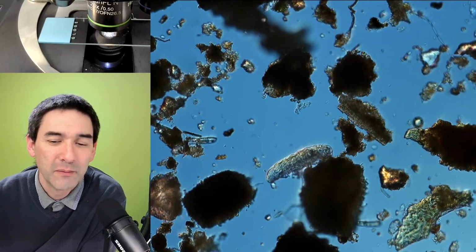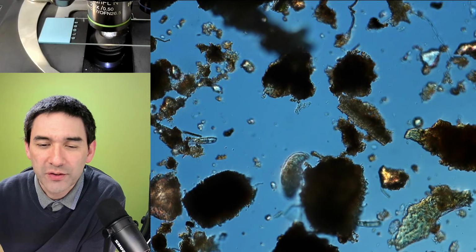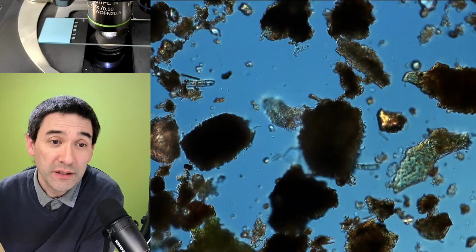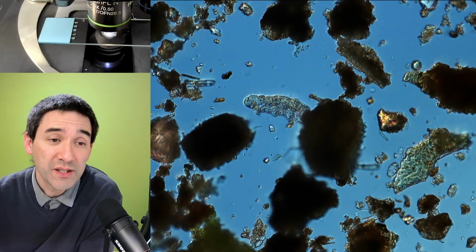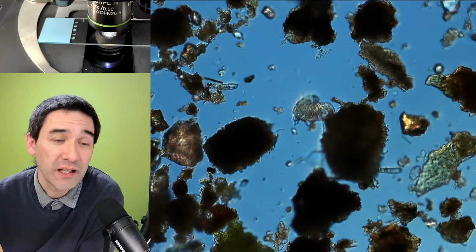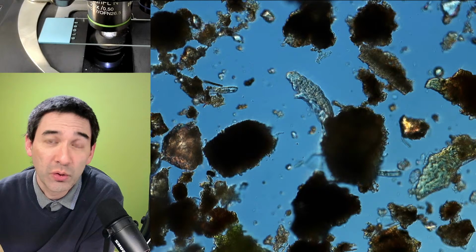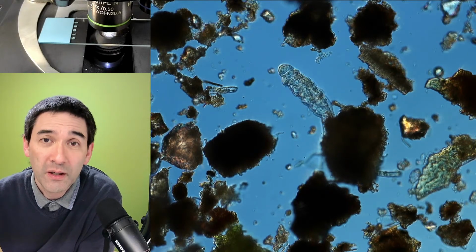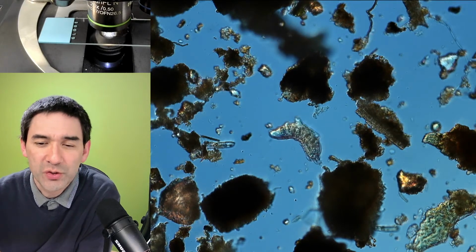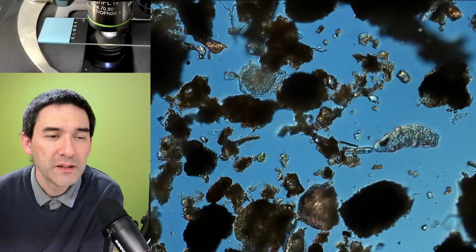Actually, heat might be better for secondary separation. Maybe warm up one side of the slide. Yeah, there are indeed microscope stages out there which can actually be heated. There are heatable stages, especially if you experiment with crystallization or so, then you might need a warm stage. And there are some other specialized microscope stages out there as well.